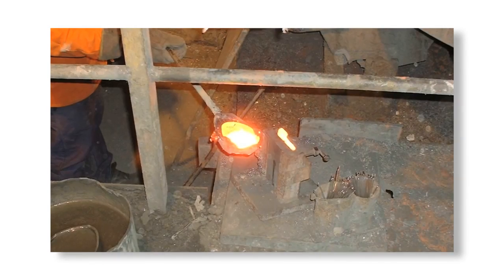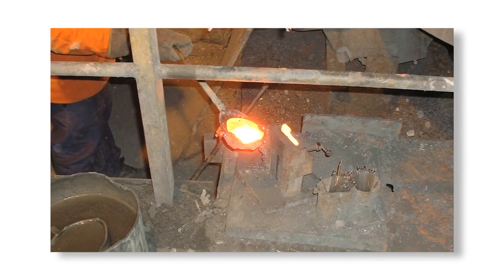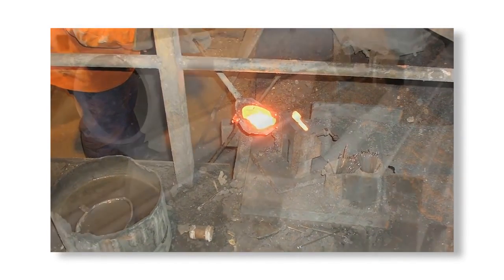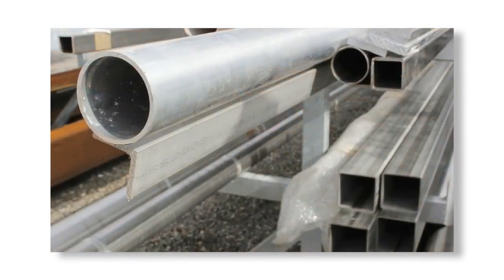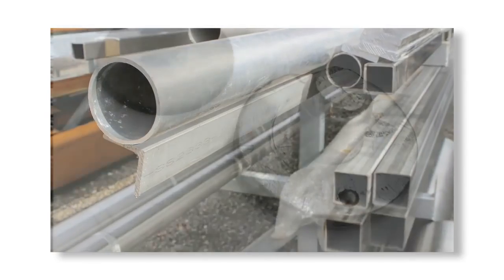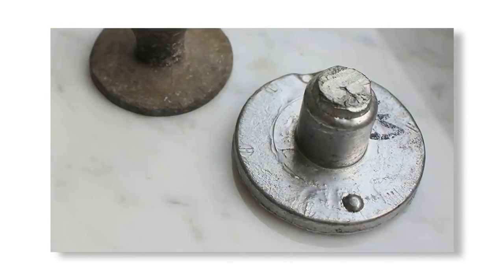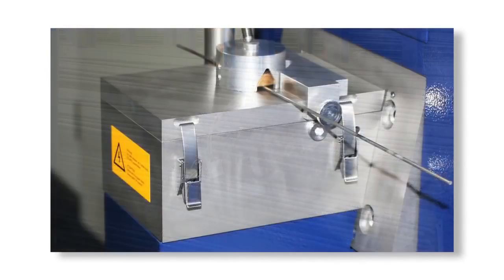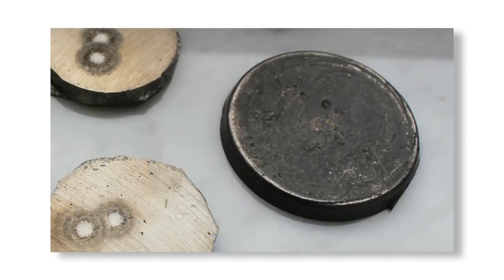The types of samples which can be tested using OES include samples from the melt in primary and secondary metal production and in the metals processing industries, as well as tubes, bolts, rods, wires, plates and many more.